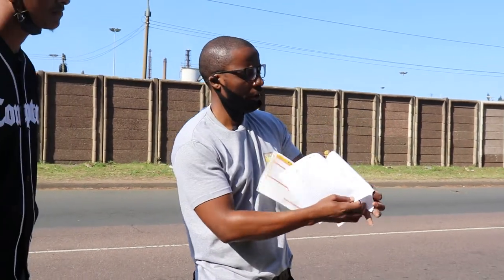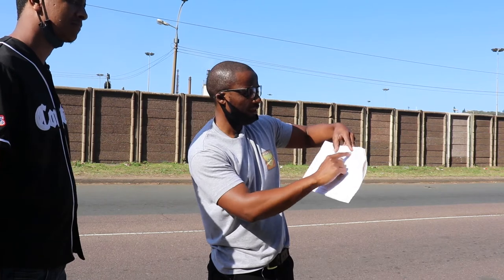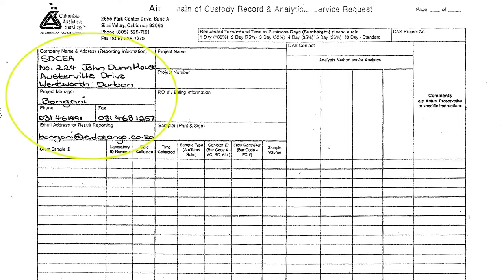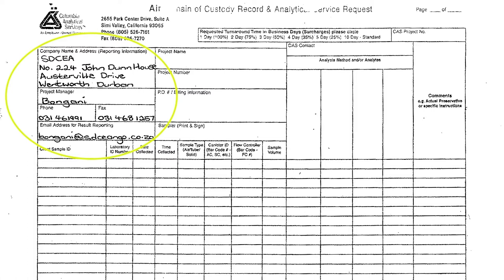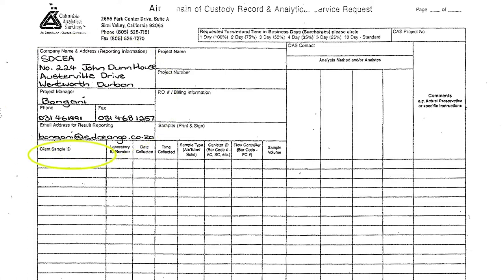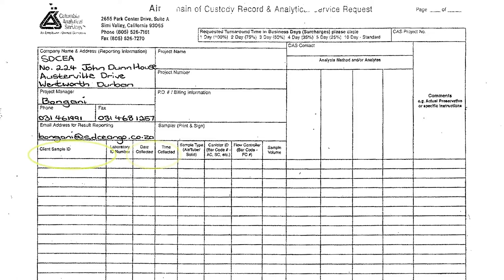And then on the last page would be part of the chain of custody. When I arrive at the office, I write the company name, the address, the person that's in charge, our details, email, address, client sample ID — exactly the ID, basically where the area is, the location, the date and the time. And then this information will go with the Tedlar bag to the lab. I'll make a copy, and it will also form part of the file in the office, so that when the results come, I'll know exactly by matching the sample ID on the chain of custody in my file.